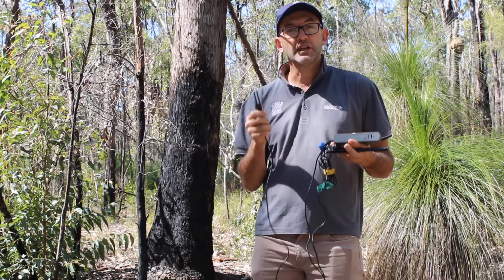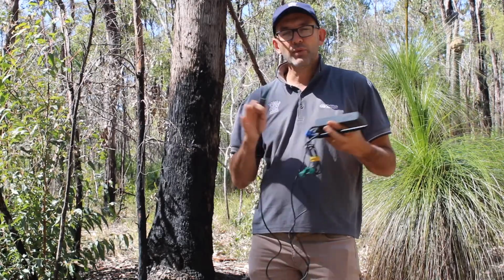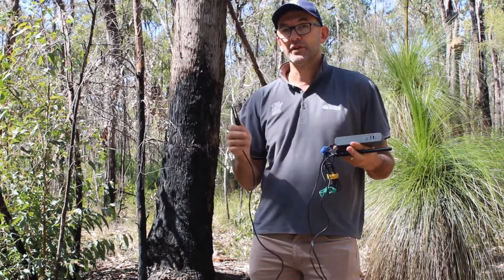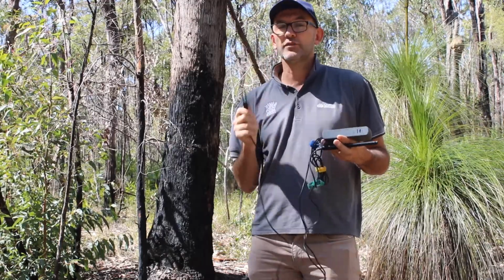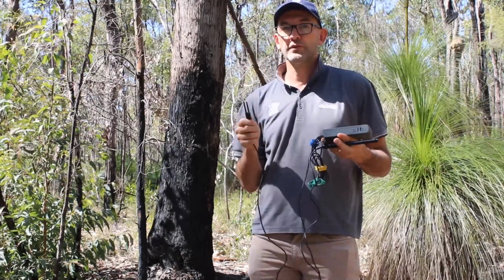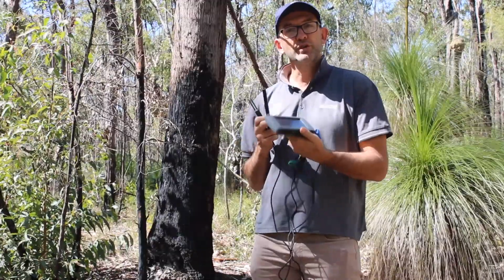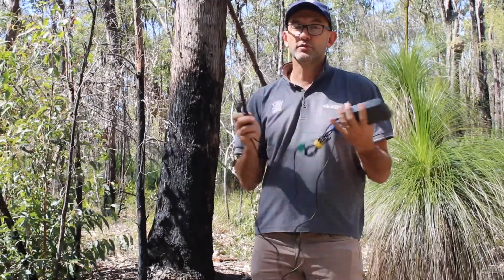The simplest thing is to find some grass. Grass does not like growing anywhere where there are rocks or hard earth, and actually loosens the soil a little bit. So in the end, if you find a bit of grass, you can insert both these probes just below it, and it should work quite well. And again, to measure those abiotic factors, you're simply using the Lab Quest to measure that data. Once that's in the ground, you should be good to go.